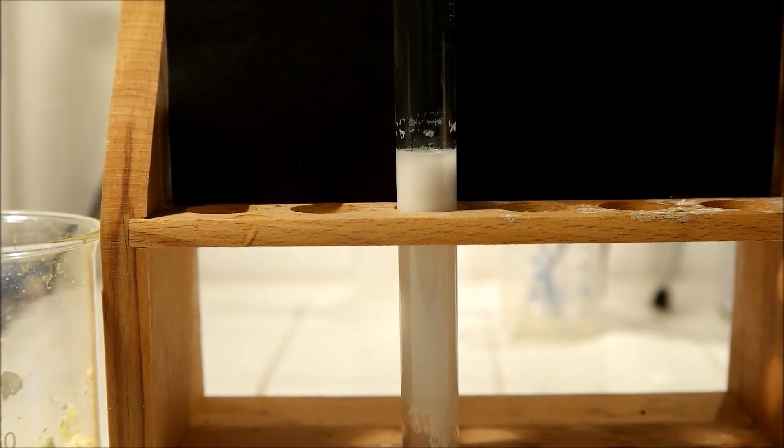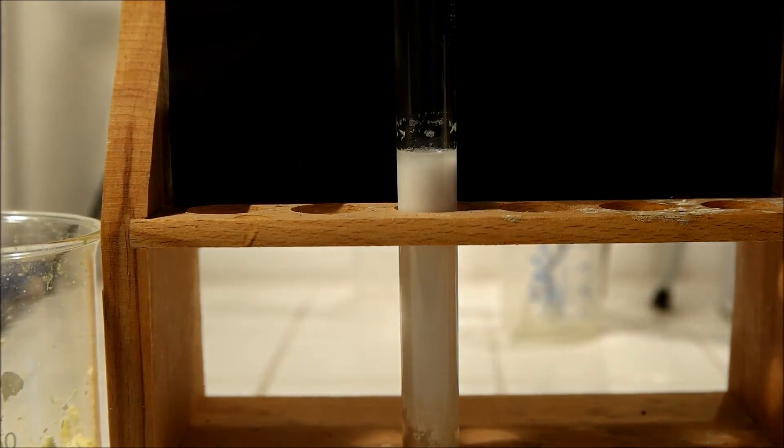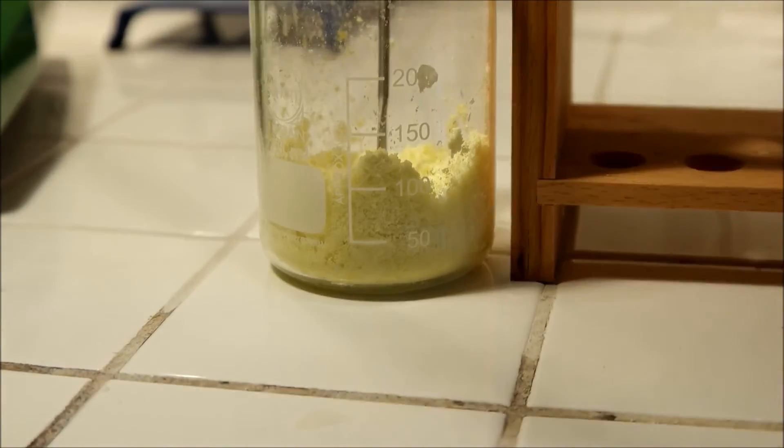That's barium sulfate, which does not dissolve. Now we know that we added some sulfate ions. Also it turned yellow, the whole stuff works.